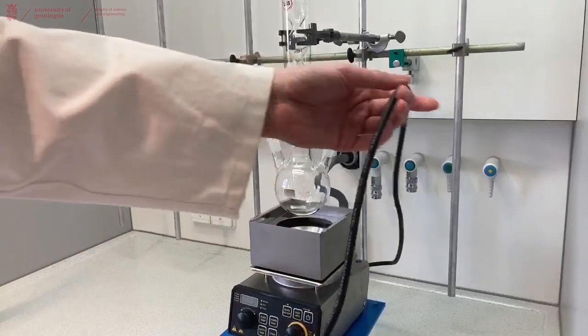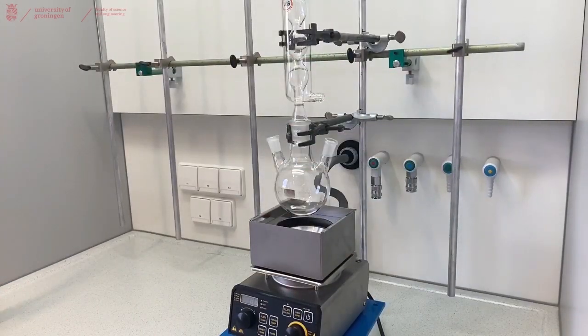Attach the power supply to the socket in front of your fume hood or in the back of the fume hood depending on which lab you're in.